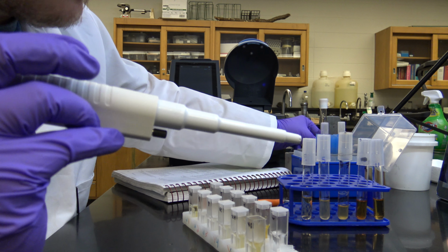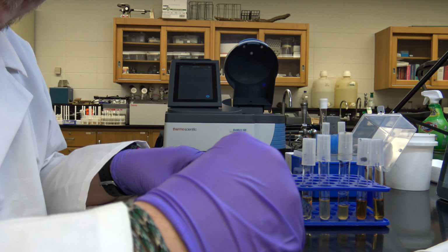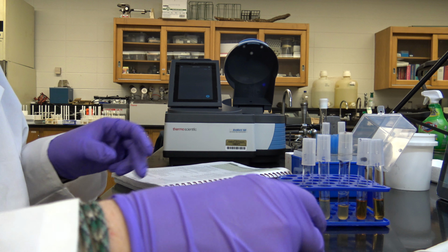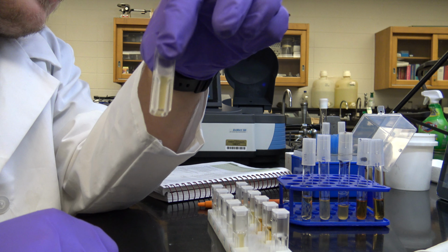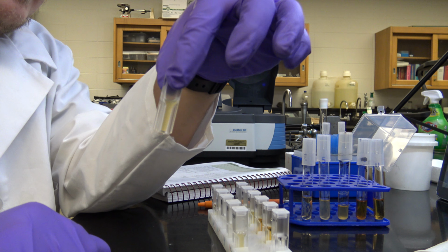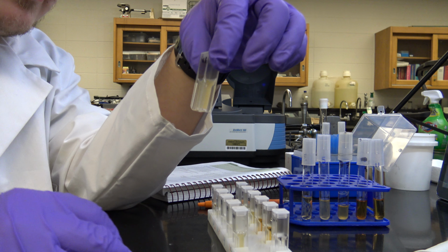So the reason that we use these cuvettes, and I'm going to go ahead and cap it, sorry. It's important to use a very clean cuvette. I'll just go ahead and show you the 48 here while I'm talking, and it should be a little cloudier, right? The reason that we use these is because they don't refract or reflect the light that the spec is going to be using. So it's pretty clear, right?